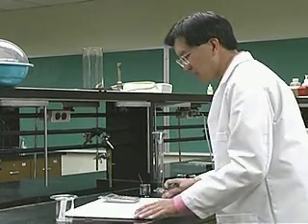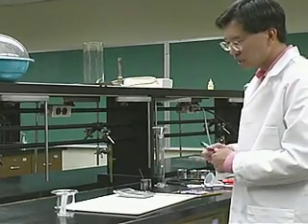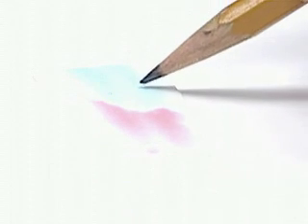Again, I did this experiment a little bit earlier, and here we have the stationary phase with the two substrates, or the two components of the substrate, pretty well separated. And they streaked really bad, so this is not an ideal case. We would probably spend some time trying to optimize the mobile phase so that we got a dot moving up the paper that was about the same size as the dot we originally spotted, as opposed to something that's really streaky like this. But in any case, we can estimate how far the particular spot moved by just taking the middle of the range of the spot.